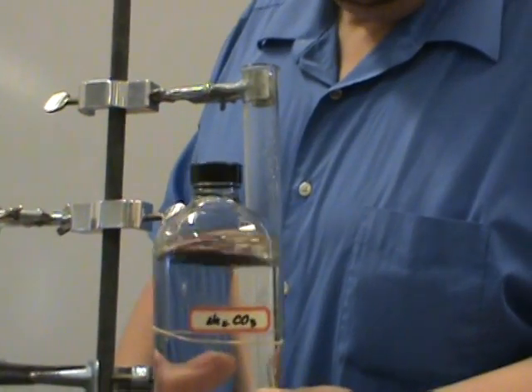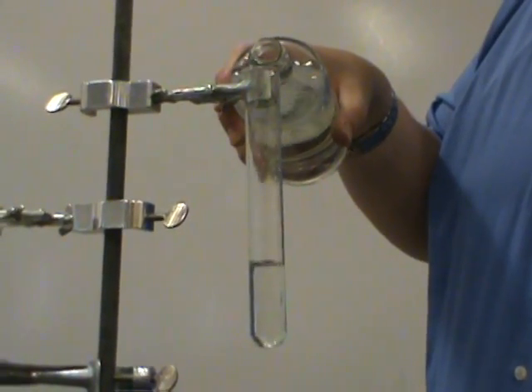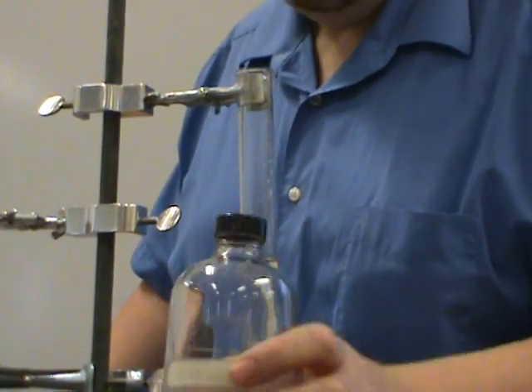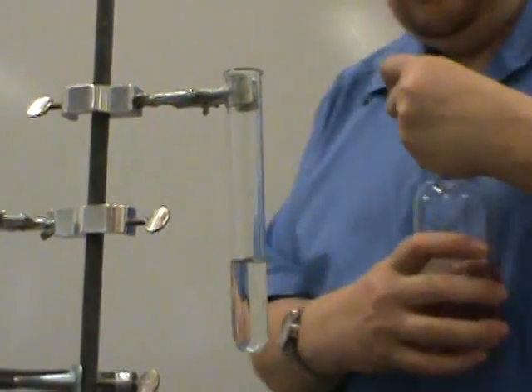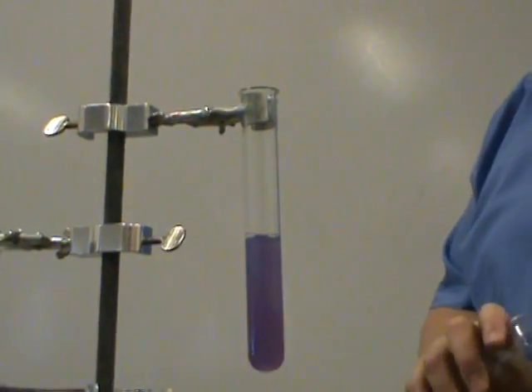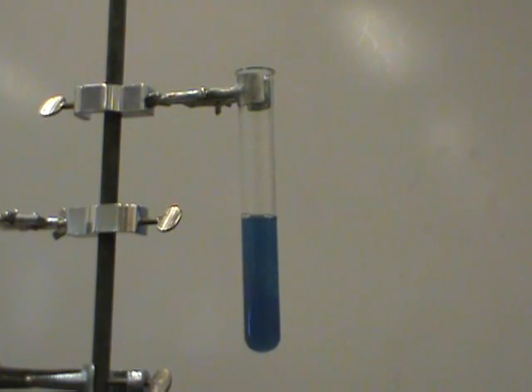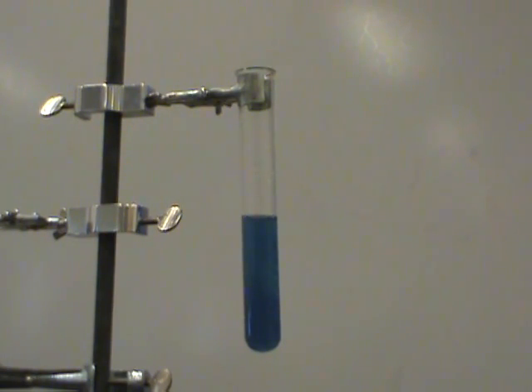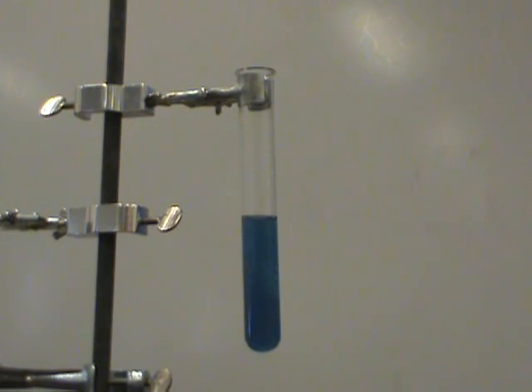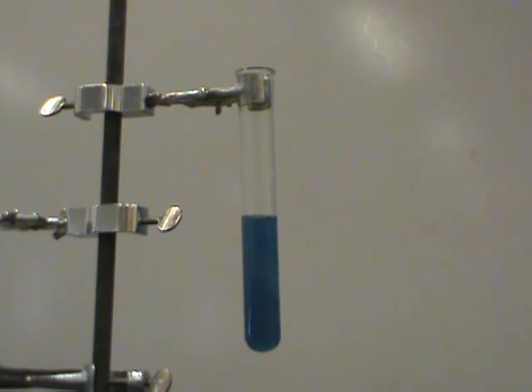Here's a simple example. We're going to take some sodium carbonate solution and add to it some cobalt chloride solution. Notice how it's transparent. When the two solutions are reacted with each other, you instantly get a precipitate — the color does change. This chemical reaction took place instantly, and the reason why is because the ionic bonds of the reacting chemicals were previously broken by the addition of water.